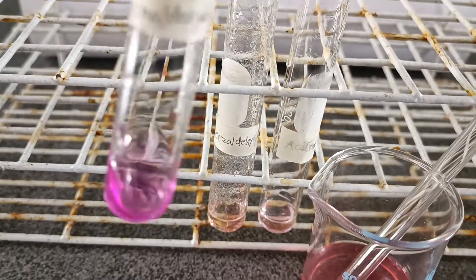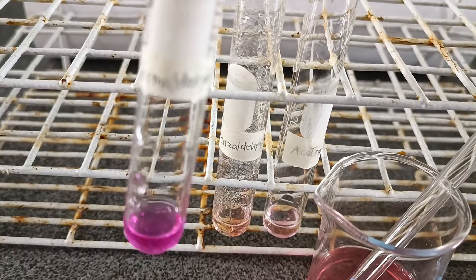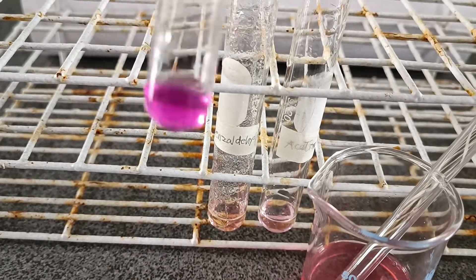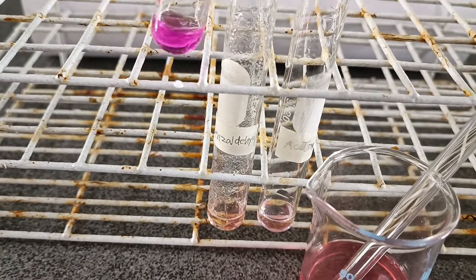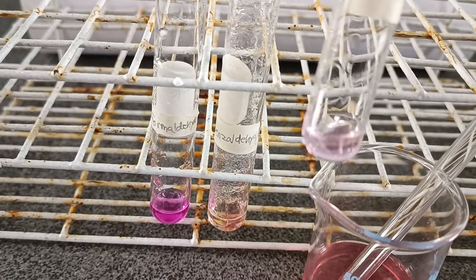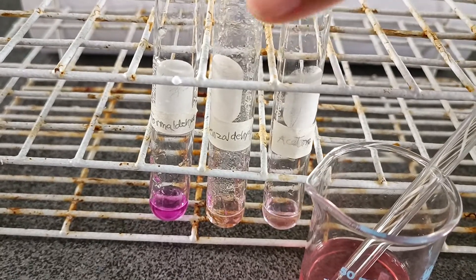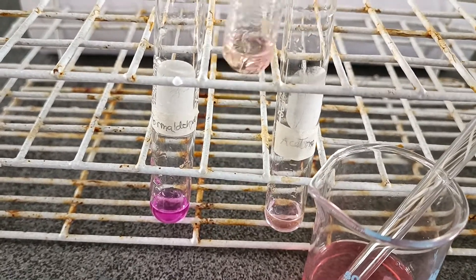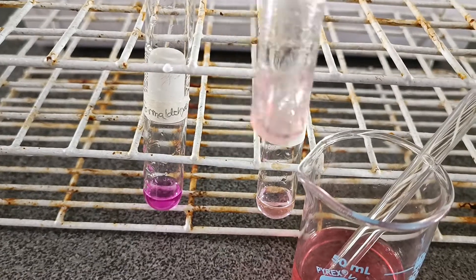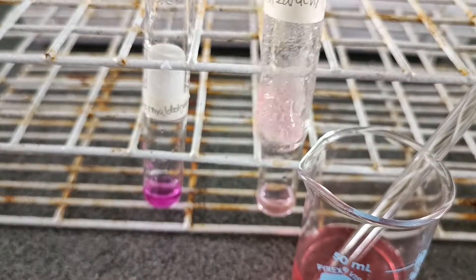This is a positive result — the magenta colored product. This is a negative result. And for benzaldehyde, it takes time for the result to show.